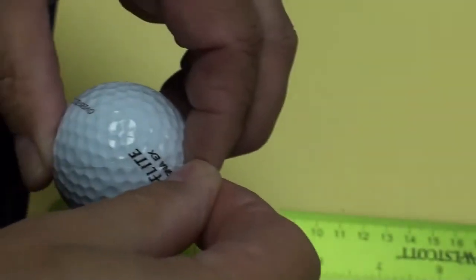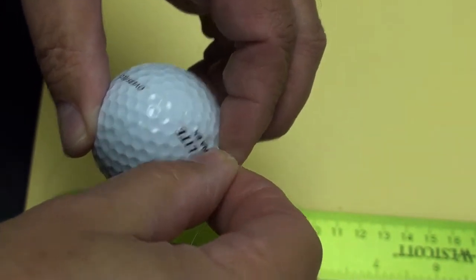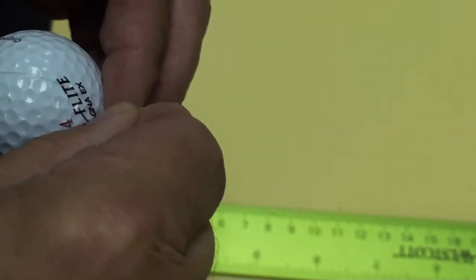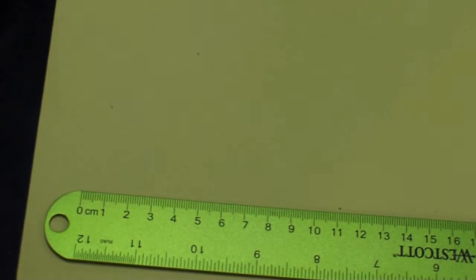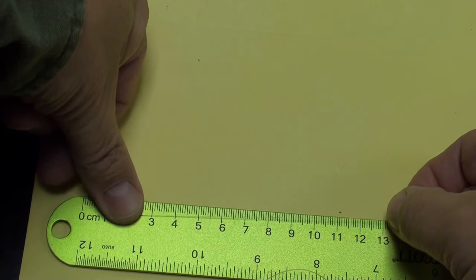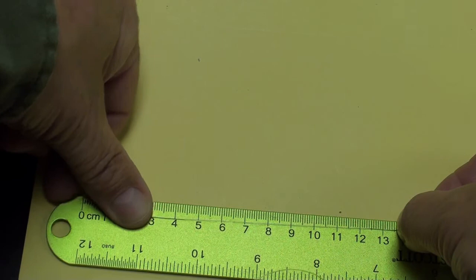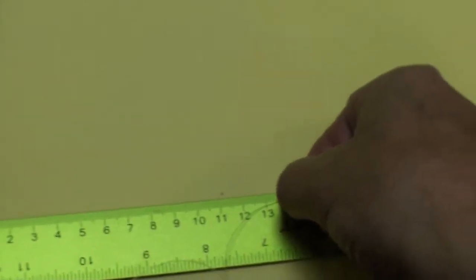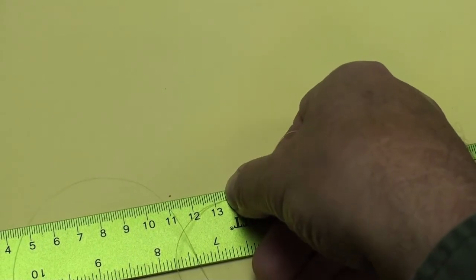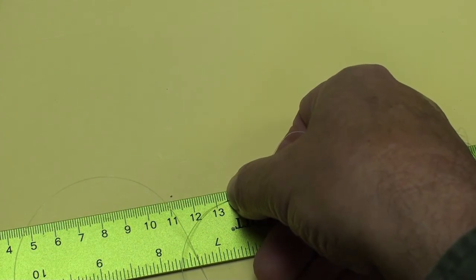Okay. So I'm taking a fishing line around it, and now I'm going to hold that fishing line. I'm trying to get the circumference of it, and then I'm going to hold that fishing line right there at that point against my ruler and see what we get. See if this thing works. It's kind of a funny way to do it. And right there, that's the spot we're looking for. I don't know if you can see that. Right where the edge of my thumb is, that is the circumference of the golf ball.